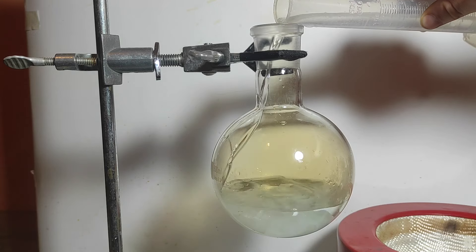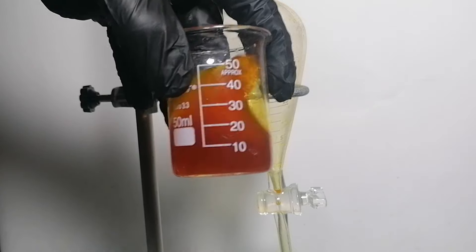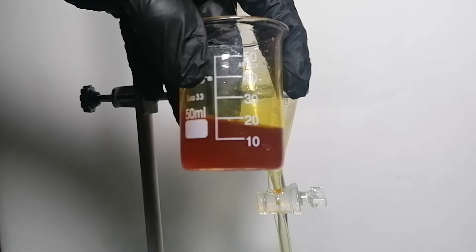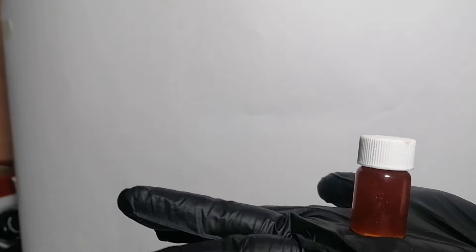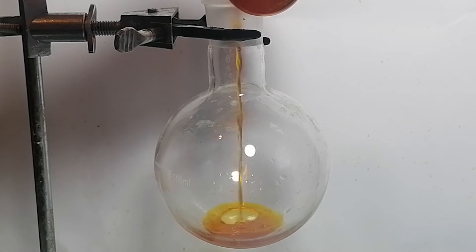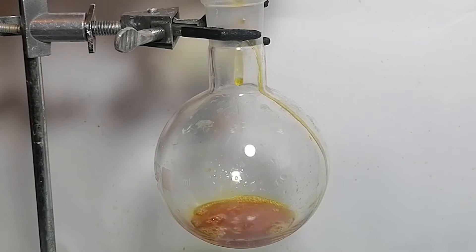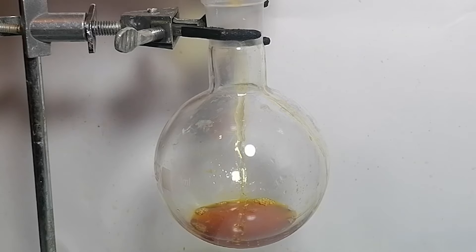So finally from colorless to yellow to orange and now blood red — here's our organic layer, which is hopefully mostly benzaldehyde. Here's me getting a beautiful thumbnail shot, and after that I went to sleep. Then the benzaldehyde was added back to the boiling flask and it's finally time to do the last distillation of the video.